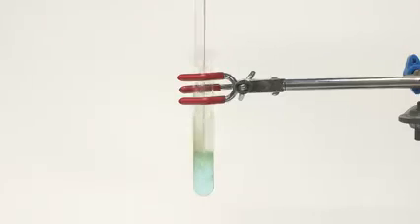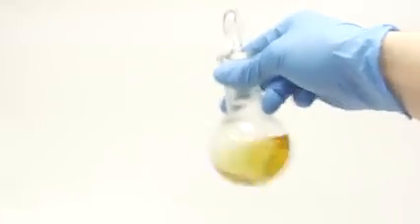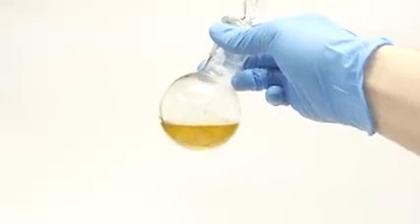I looked around online a little bit, but I couldn't find a distinctive test that would actually tell me if I have an ester-containing compound. All the ones that I found would give a false positive if fatty acids were present, so in my case, they were pretty useless. Luckily, a very nice friend of mine offered to run an IR analysis. So I went over to his lab, ran a sample, and then proceeded to be sad.